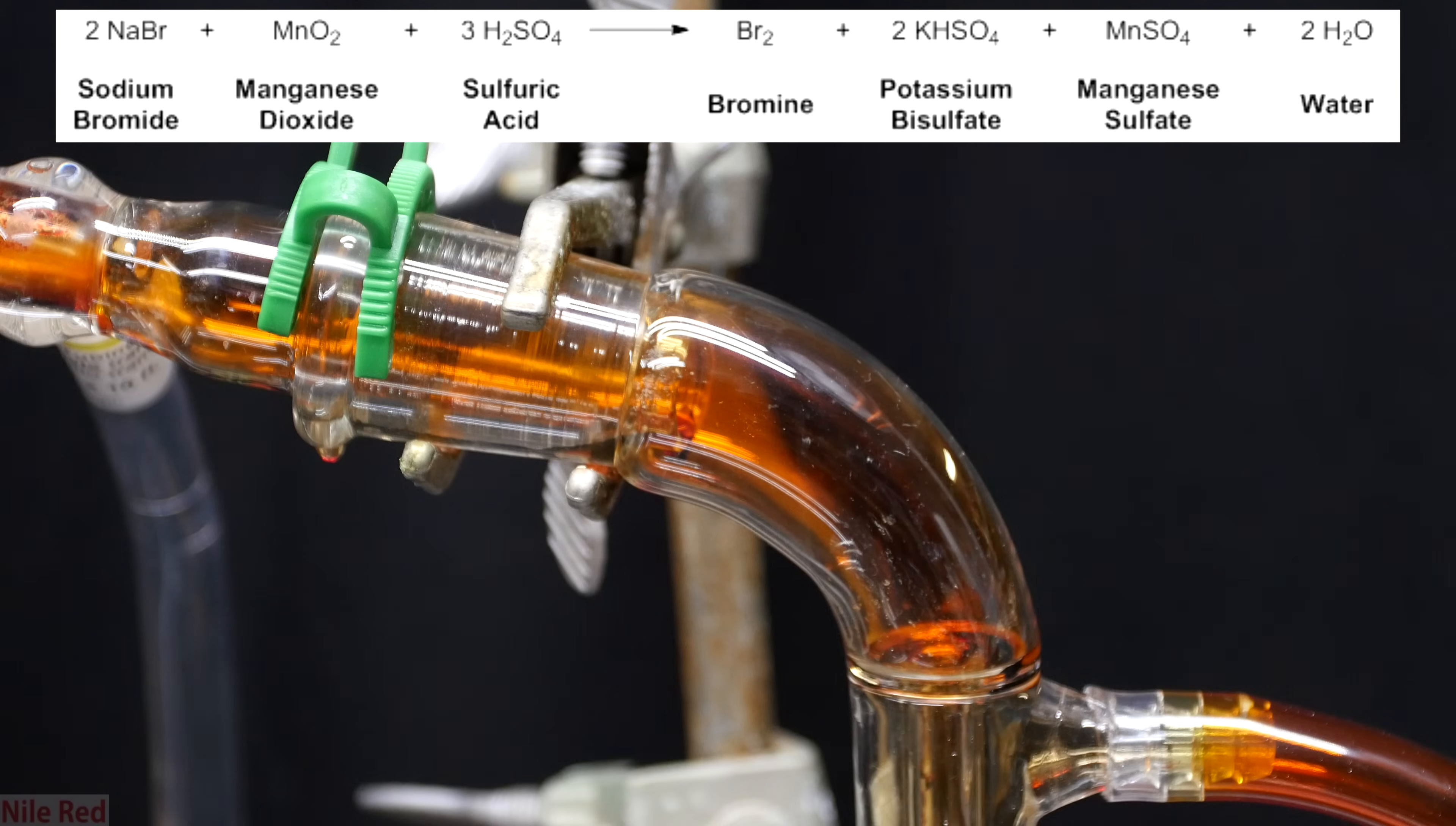But like I said before, I chose manganese dioxide because I thought it was the easiest to get for most people.